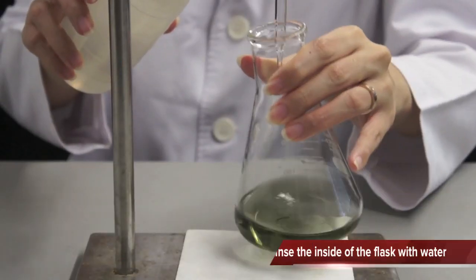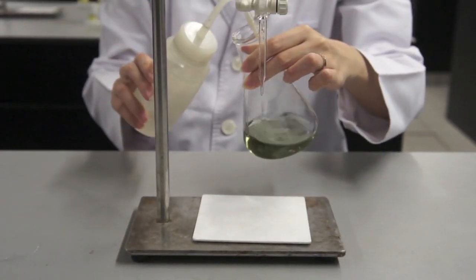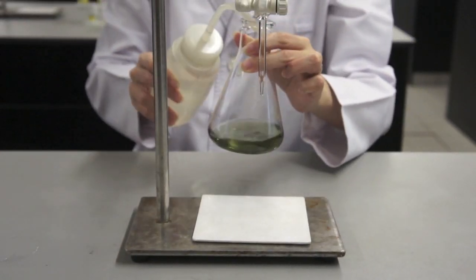During the titration, you might have splashed a lot of solution on the inside of the flask. Rinse the inside of the flask with distilled water.